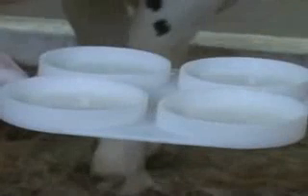If you look carefully, you will see that there are 2 circles in the bottom of each cup. These circles indicate the amount of milk and reagent that needs to be added for the test.